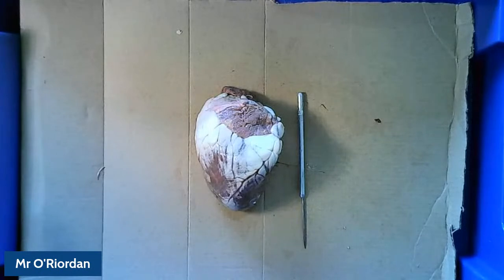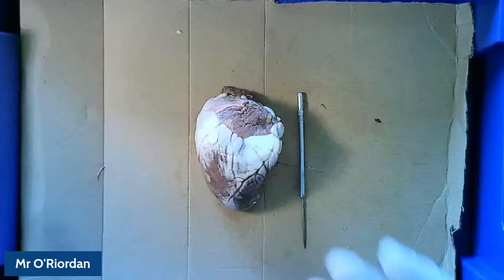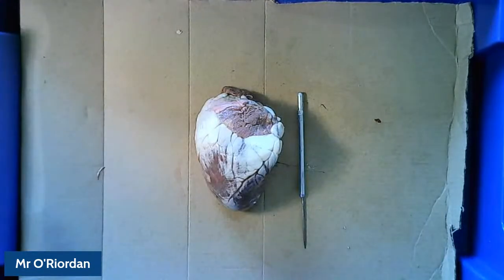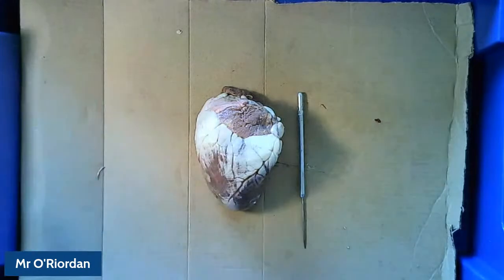Once again, if you are a bit squeamish, you've probably turned off already — but this is a sheep's heart and I am about to cut it up. So if you don't want to see that now, it's a good time to not look.